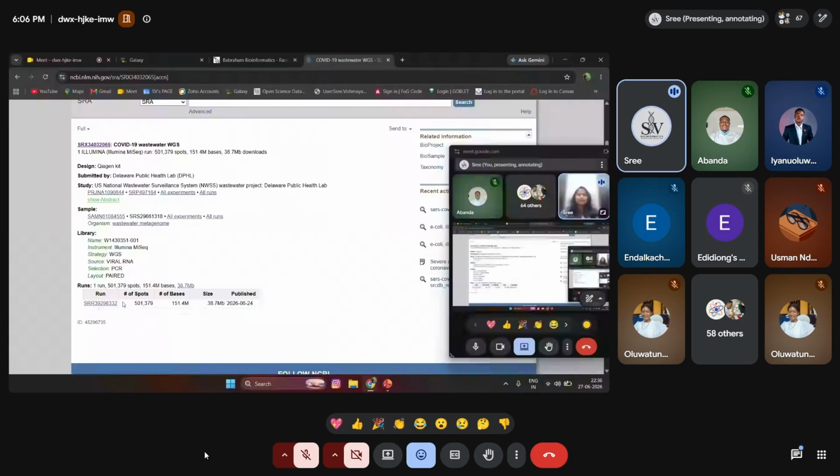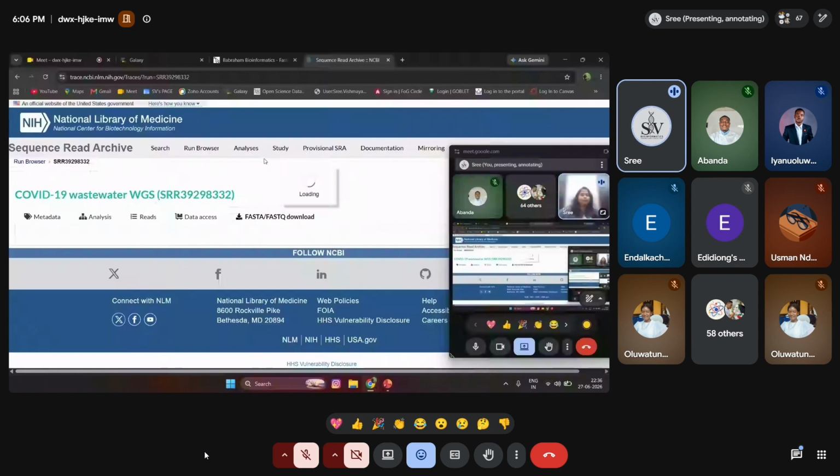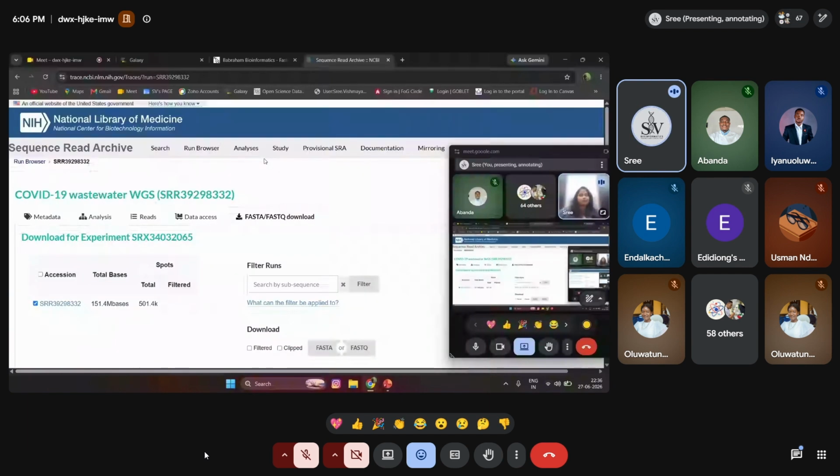This is the SRR ID. I'm checking whether this ID is published or not. If it is not published, then it is difficult for us to get it. So you get the information over here. You can get the metadata, analysis, reads, bases, and you can see the FastQ file over here.